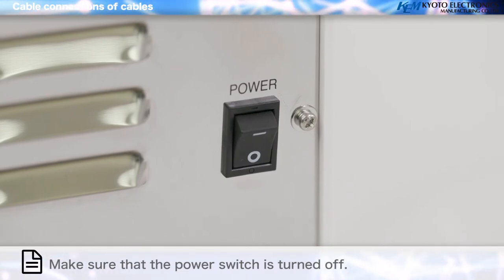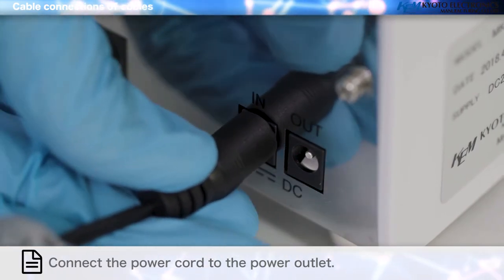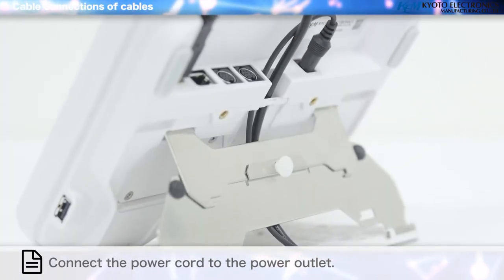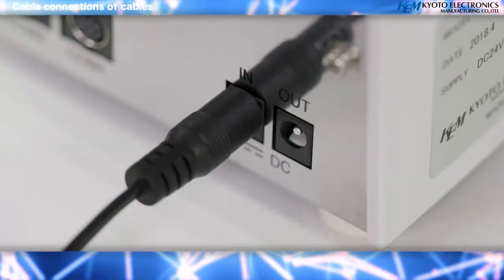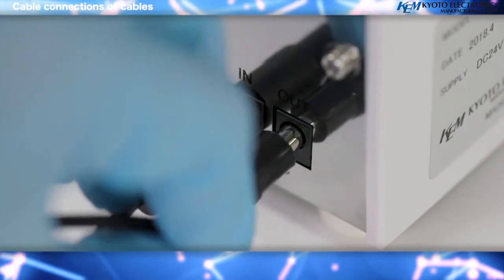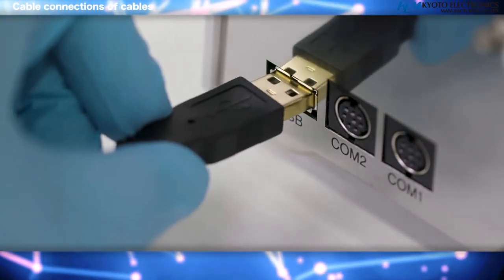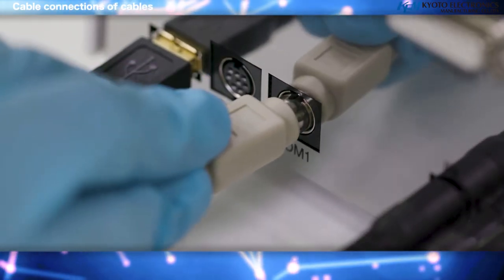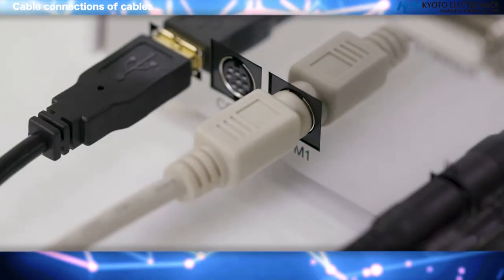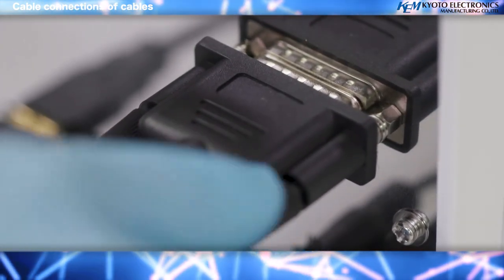Cable connections: make sure that the power switch is turned off. Attach the power cord to the AC adapter and connect the connector plug of the AC adapter to the power connector on the back of the main unit. Connect the stirrer cable to the stirrer and the main unit.